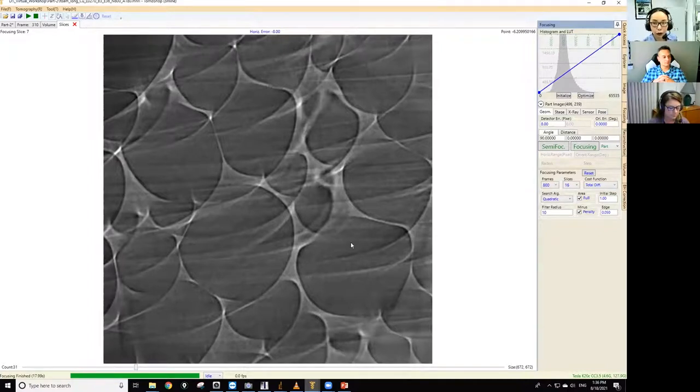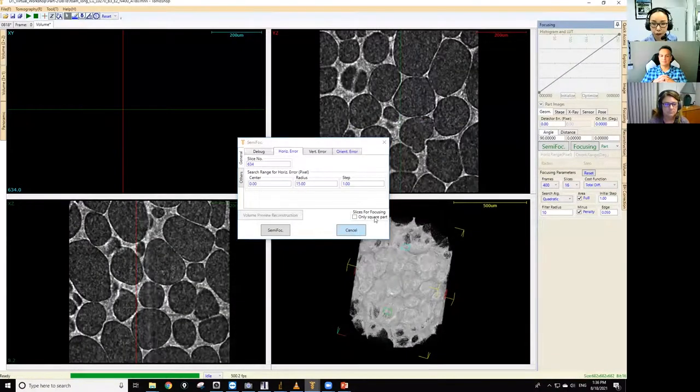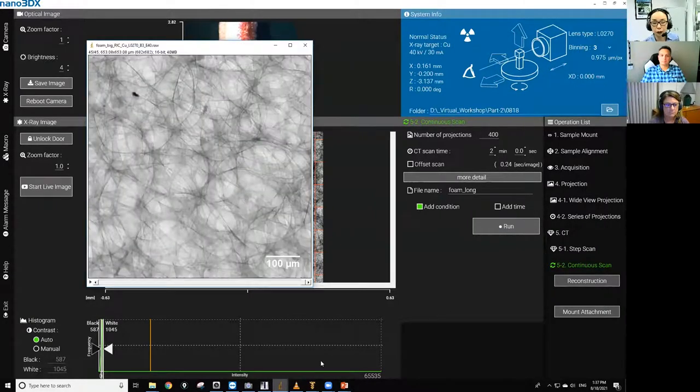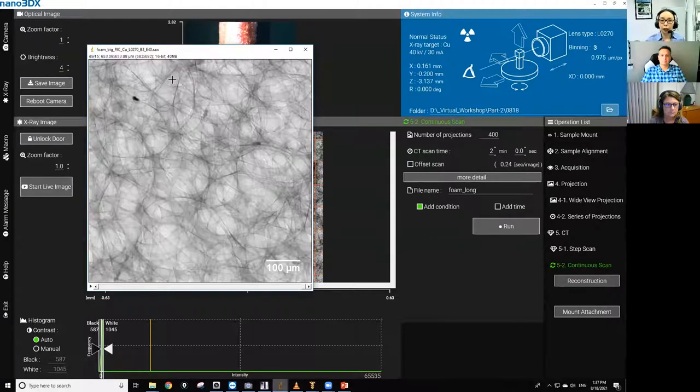Now, I'm going to show you something else. Let's say that you're planning to do a 10, 20 hour scan. You don't want to spend 20 hours and hope for the best and come in next morning and realize your sample was moving. That's probably not a good strategy. So if you're planning to do a long scan, I would recommend you take a look at the projection like this one. This is just a 2D projection, not 3D CT. Collect the projection every minute or so for 45 or 60 minutes to see if the sample is moving or to see how long it takes for the sample to settle and stop moving.